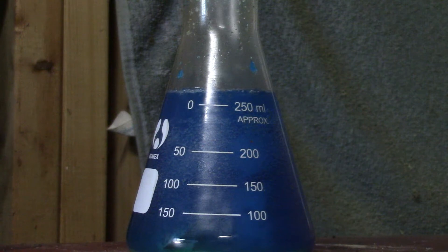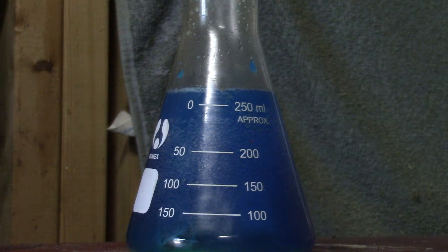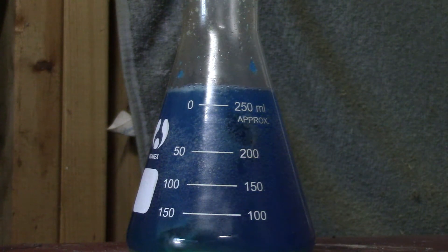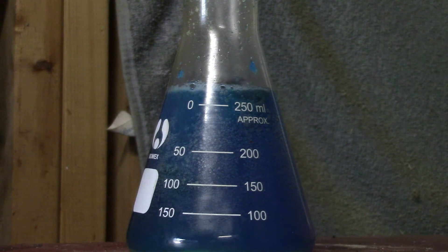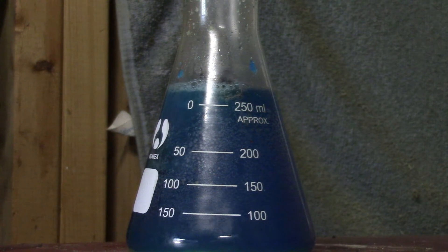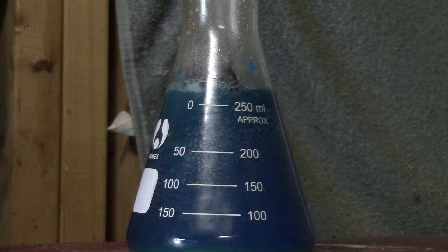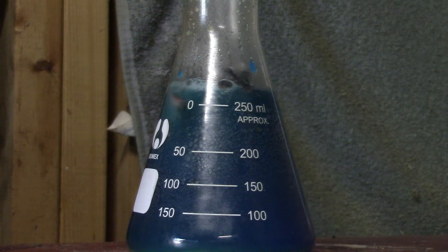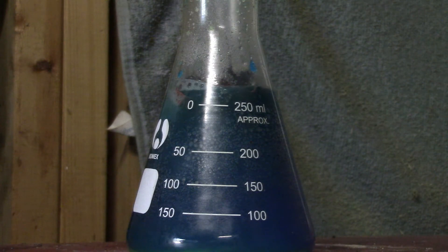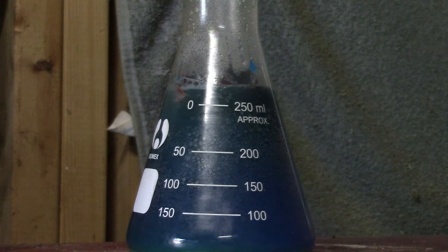The reaction is picking up pace. The reaction of aluminum with copper sulfate is an exothermic one — it gives off energy in the form of heat, which brings the reaction to boiling temperatures and also gives off hydrogen gas you can see bubbling out of solution. So why did adding the sodium chloride to the solution of copper sulfate and aluminum cause the reaction to start up and drive to completion versus not having it at all?